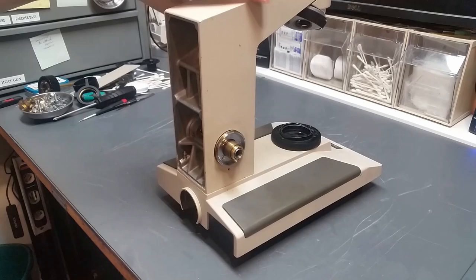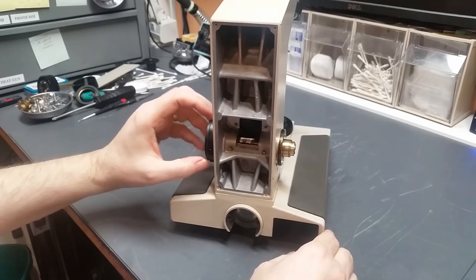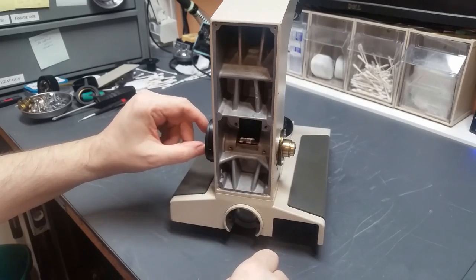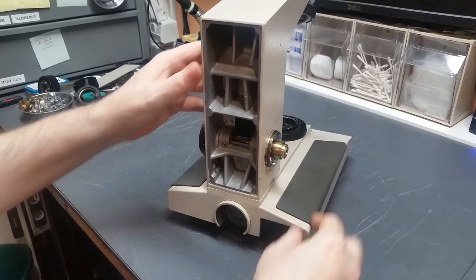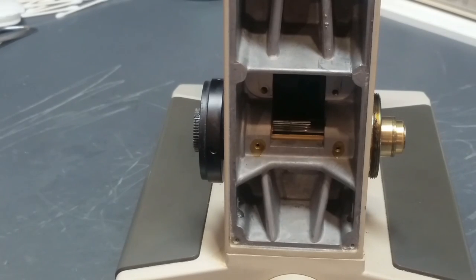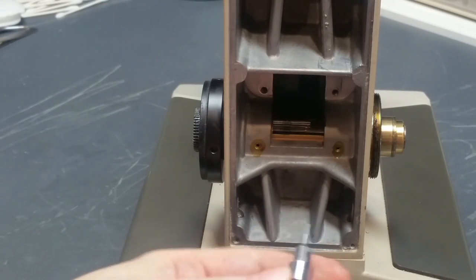Okay, now for the next step of this, we're going to take out this entire pinion assembly. So that's this piece with the gear on it. That includes this tension adjustment knob and this whole thing. And let's see if I can zoom in a little bit. Now the way to do that is to take your 1.5 millimeter hex tool.